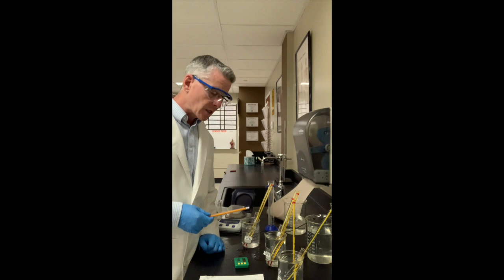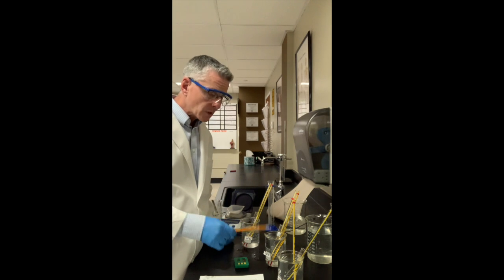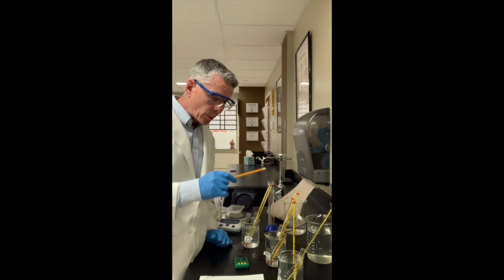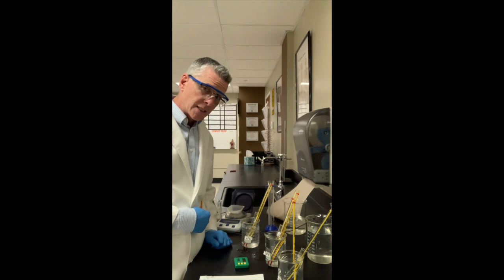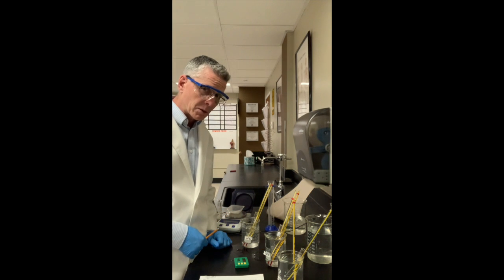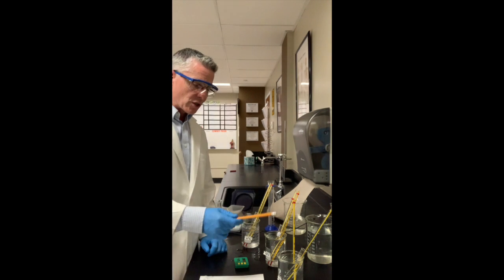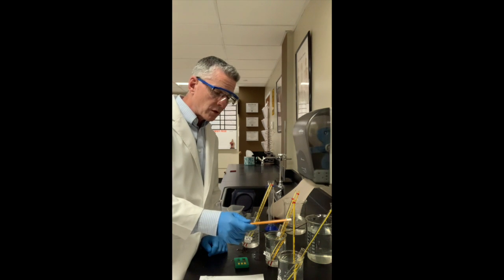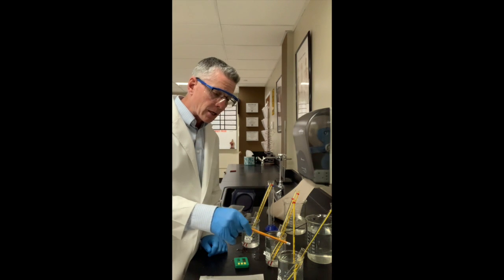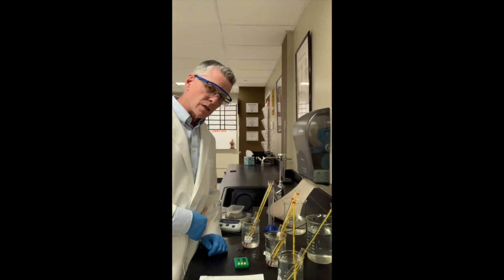Now, what we saw with some of the other ones is that this cold one started at 3 degrees. This temperature came down. They hit equilibrium at 6 degrees and plateaued right there. Here, we started at 37.5 degrees. We went down to 25 degrees, but this temperature didn't change. 37 to 25, there was no real loss of energy into the surrounding environment. In this case, so far what we have seen, and that's 2 minutes, we are at 44 degrees. We're at 44 degrees, so it'll be interesting to see what happens to the water bath if the temperature of the water bath comes down and the temperature of the body, the faux anus, continues to go up, if they'll hit equilibrium just like we did in the other beakers.